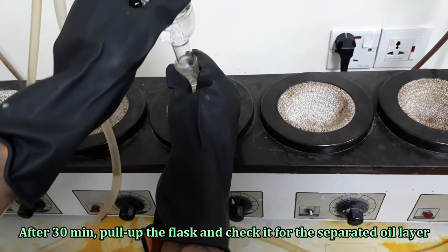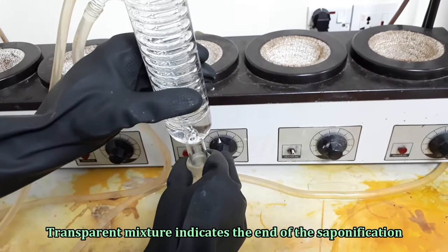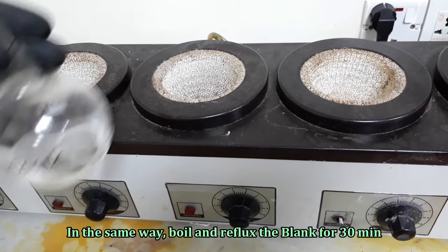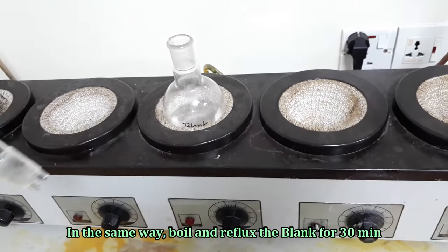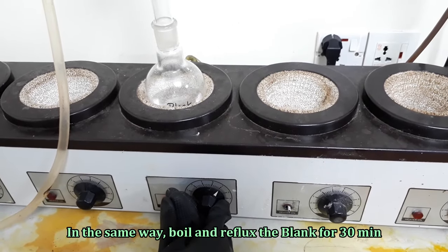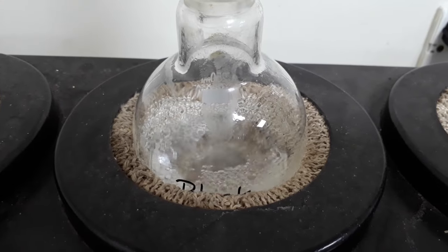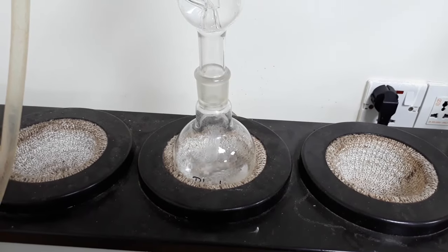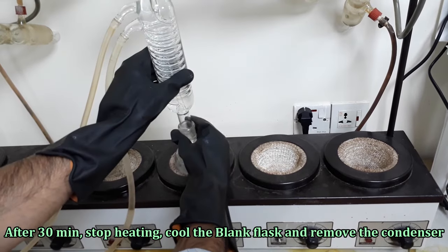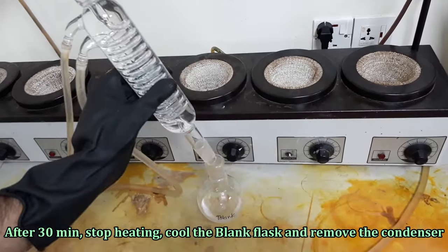After 30 minutes, pull off the flask and check for a separate oil layer. In this test, no separate oil layer is seen and the mixture looks transparent and clear. A transparent mixture indicates the end of the saponification. Now cool the flask and remove the condenser. In the same way, boil and reflux the blank for 30 minutes. After 30 minutes, stop heating. Cool the blank flask and remove the condenser.